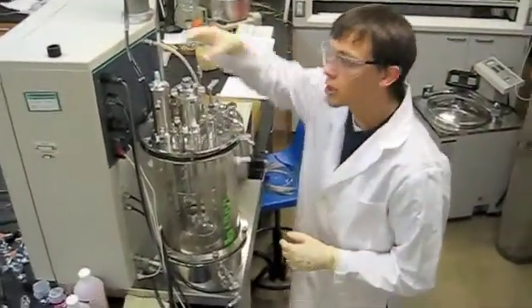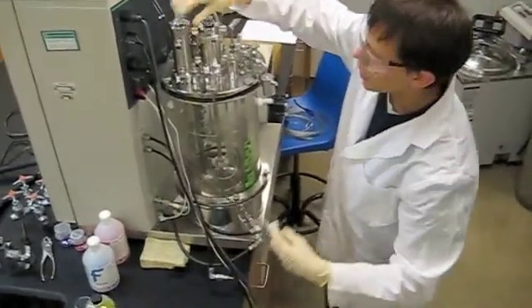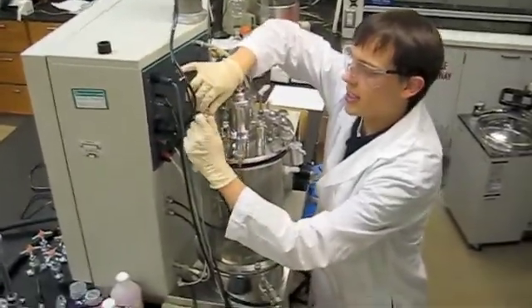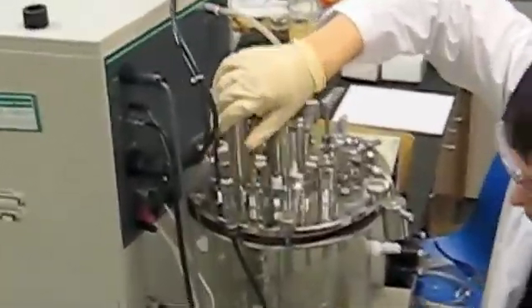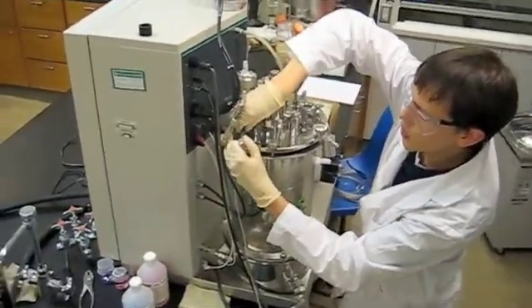After that, we are going to hook up the condenser with the water in and water out for that. How you do this is you pull back on the sleeve, stick in your connector, and then release the sleeve, and you're going to do the same thing for the one on the bottom.